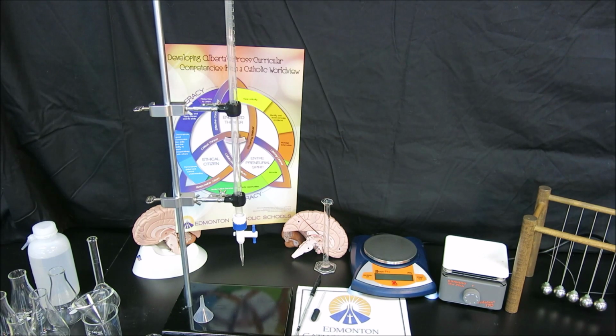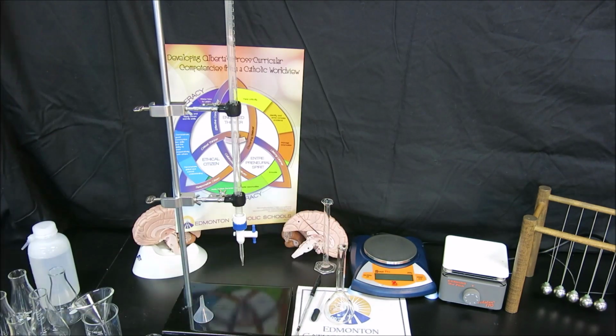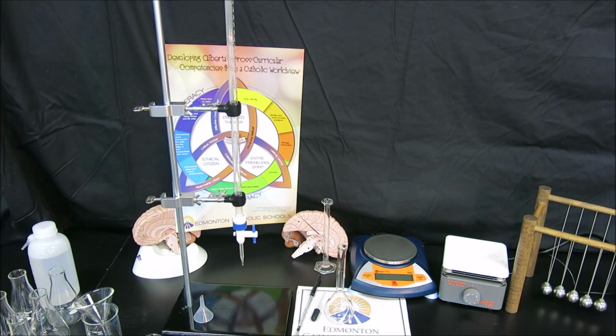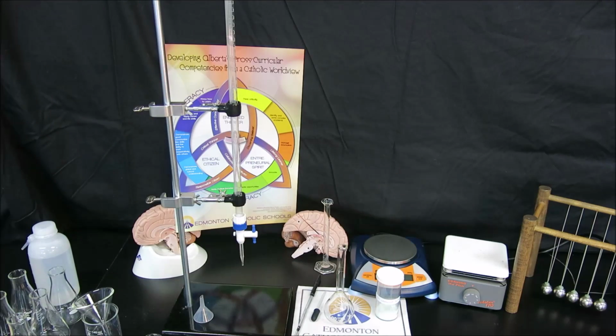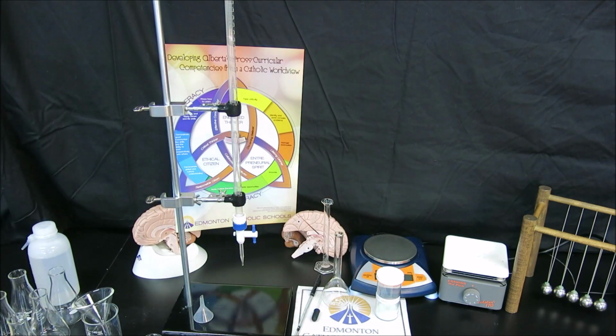That concept of standardizing a titrant involves creating a solution from scratch of something called a primary standard. In our case, our primary standard is going to be an iron 2 ammonium sulfate complex. The mass is calculated based on the concentration of this solution to be 0.05 moles per liter for a 100 milliliter volumetric flask. So part of your lab, of course, is to calculate the mass required of this primary standard.